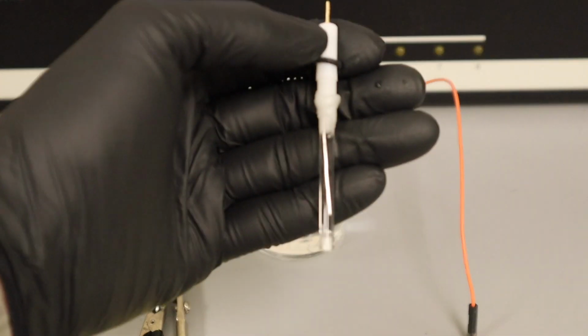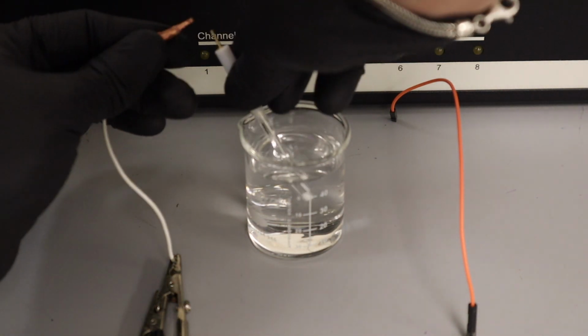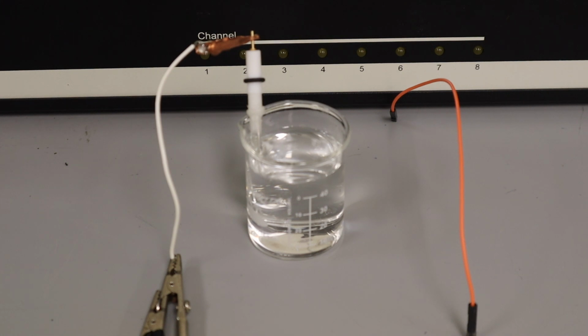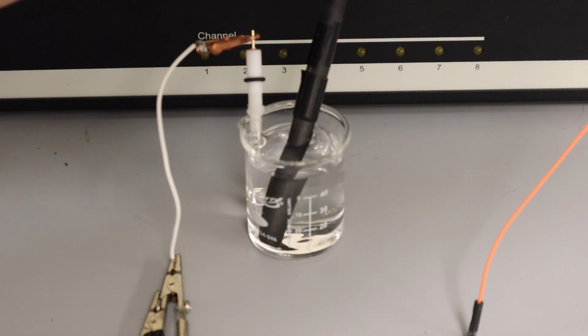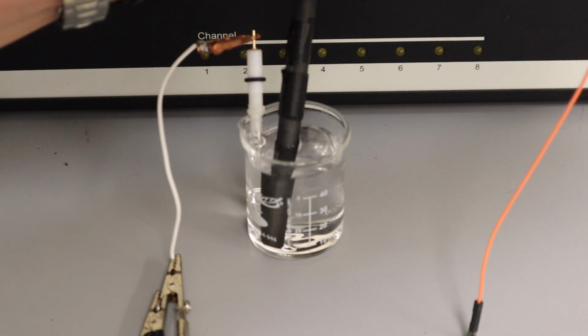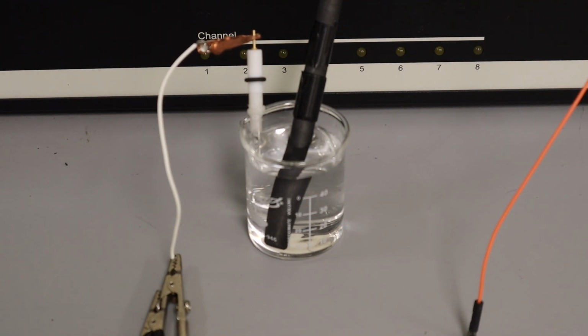and we can do this by taking our reference electrode, which is this guy here. So we'll take our reference electrode and we will hook it up according to the Gamry's instructions. The Gamry has a test reference electrode measurement installed, so that is one of the tests that you can run, is test your reference electrode. So we'll hook our reference electrode up there. Then we will take our carbon rod counter electrode and hook that up on the other side here. And then the last step is I will switch over from the multiplexer to the single channel data collection style.